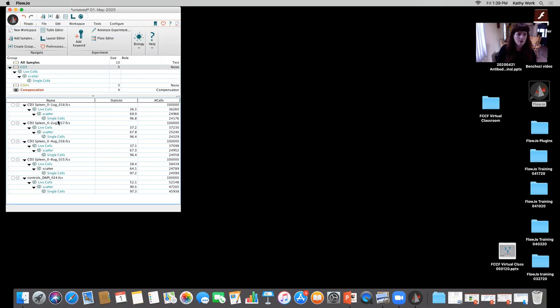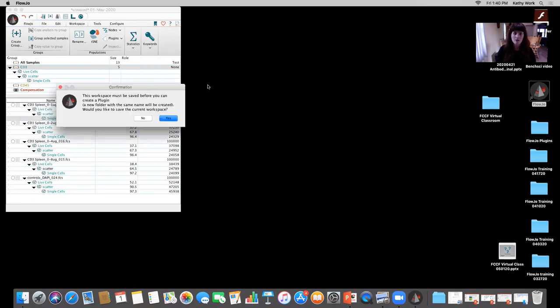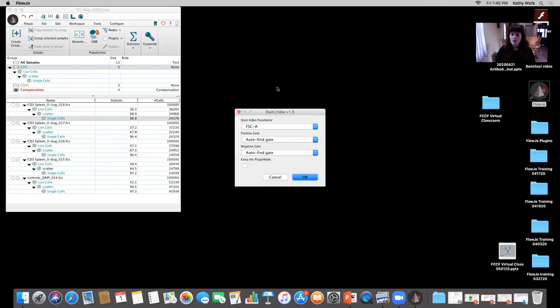Okay, so I'm going to highlight the single cell gate now that I have it all gated. I'm going to go to workspace and plugin. These are the plugins that I have specifically on this computer. The only one that we're going to be reviewing today is Stain Index. If you choose Stain Index, it's telling me that I need to make sure I save the workspace. I'm going to hit yes. I go to my antibody titration, okay, I'll leave that name. That's fine. And then it's telling me I need to choose the parameter that I'm trying to do the stain index off of. That parameter is going to be the CD3, right? So it's the APC-Cy7. I choose that detector. And then you have the option of either having pre-gated or for it to automatically find the gate for you. So I'm going to choose auto find and we'll see how it looks.